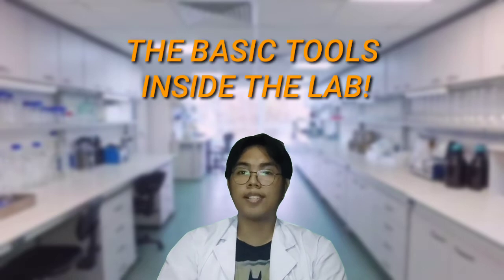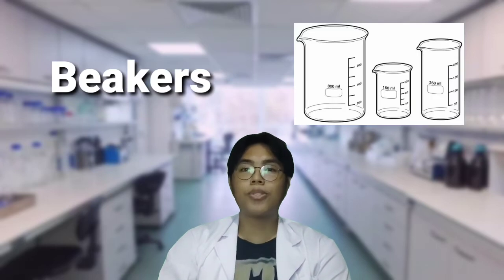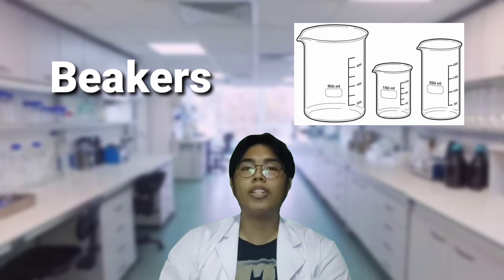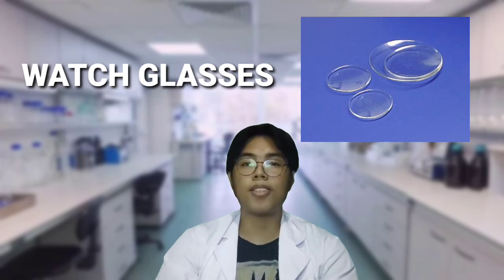Now, here are some of the basic tools that exist inside the cell and molecular biology lab. Beakers. These are used to retain liquid or solid samples or as a container for reactions. They are also used to collect filtrates from filtering processes as well as liquid from titrations. Watch glasses. These circular glasses are used for holding small samples and for covering the beakers.